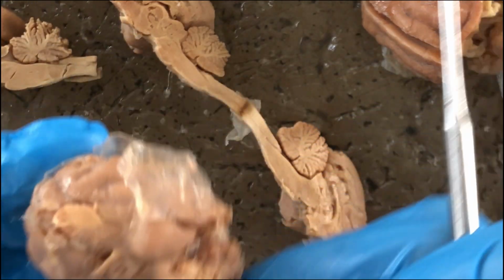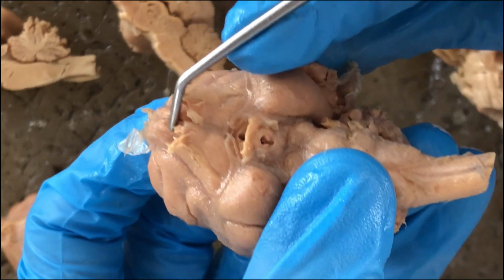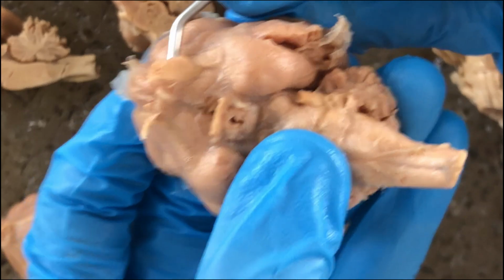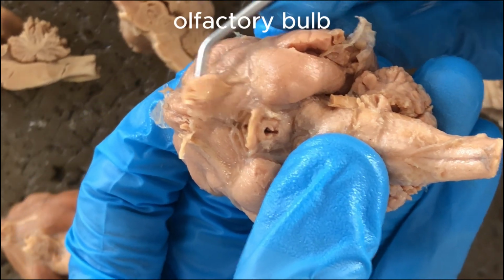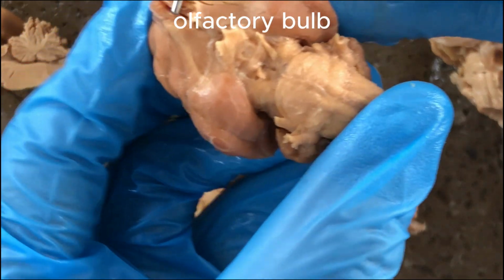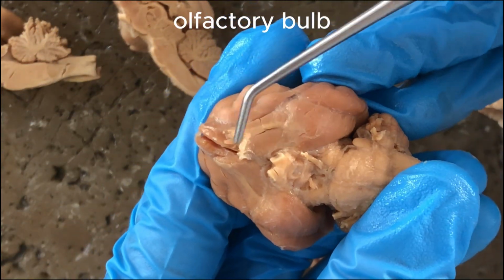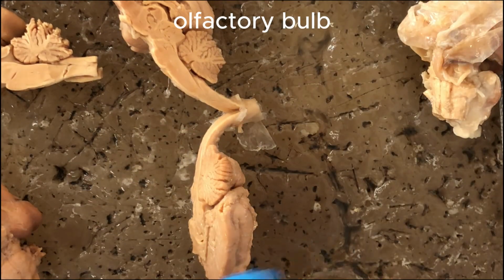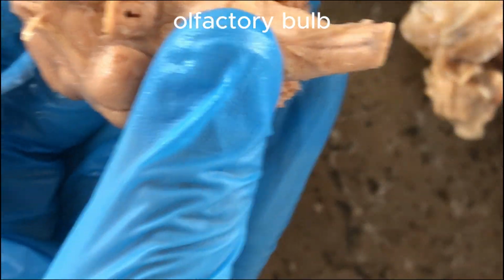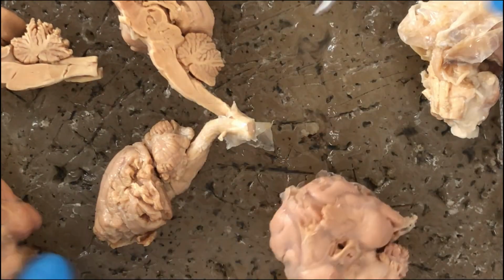Let's examine the ventral side. In the rostral portion, you'll see 2 structures called the olfactory bulbs. In this specimen, it has been removed already, but there should be 2 olfactory bulbs here, like this one, olfactory bulb.